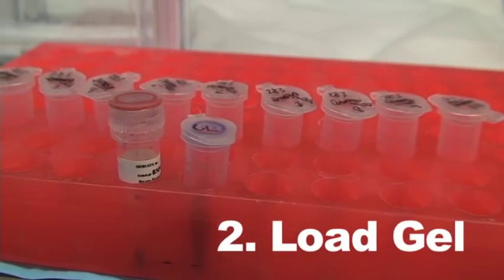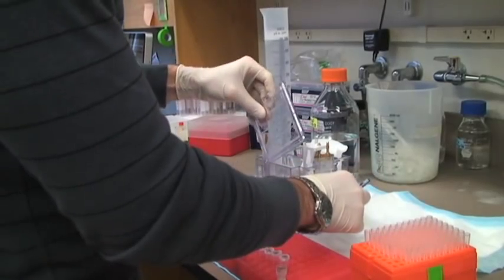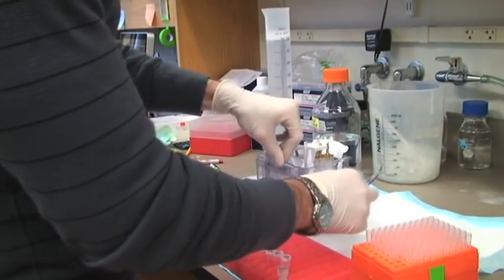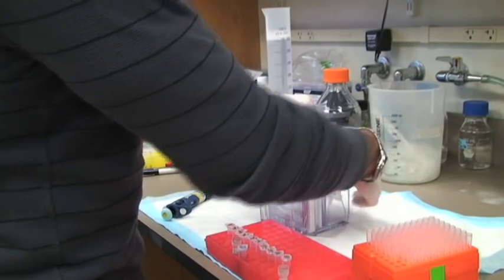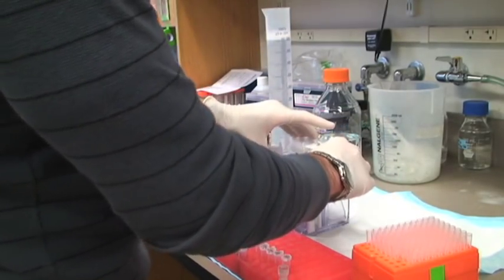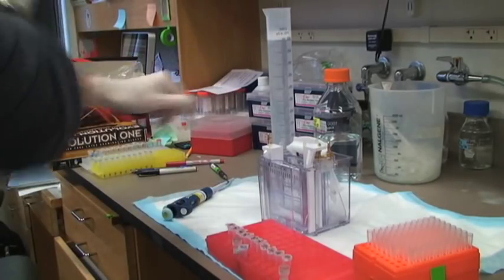Now all of Larry's samples are in Eppendorf tubes with a blue loading dye added to them to help visualize them. He's going to load them into a precast polyacrylamide gel, and the buffer that he's going to add to the box is an SDS buffer.